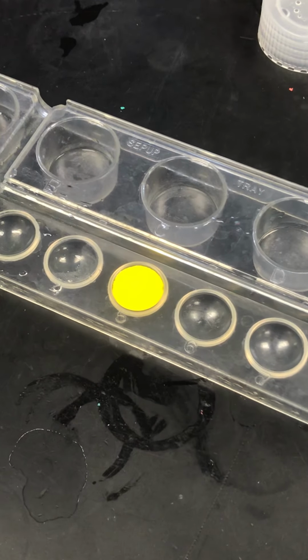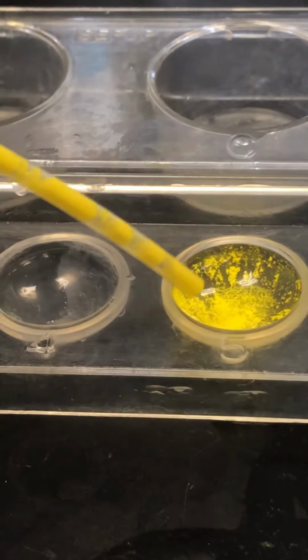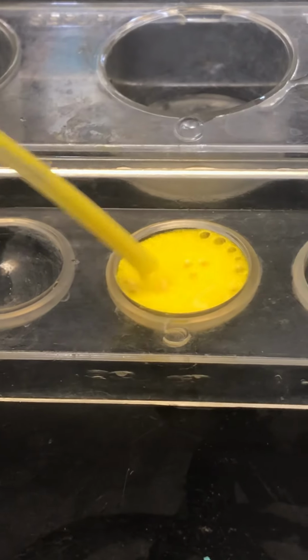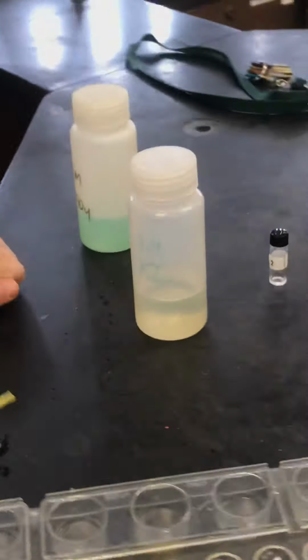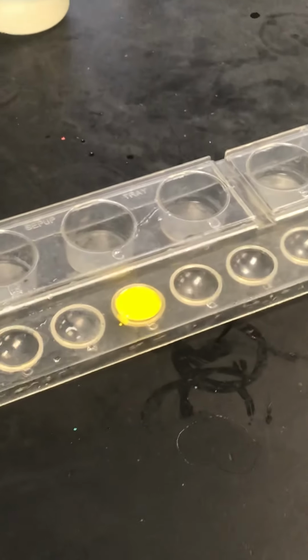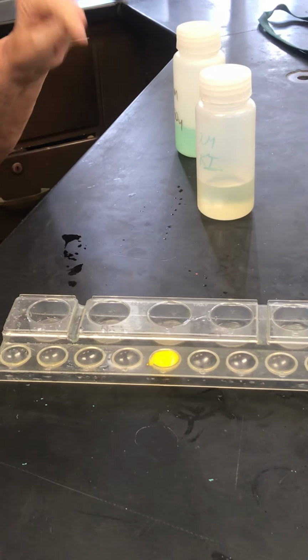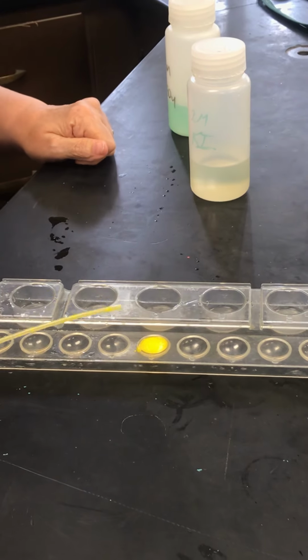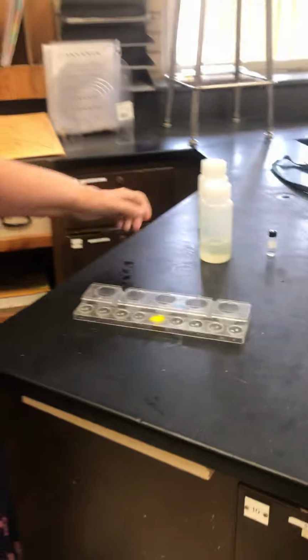I think it's yellow goo. Wonder if I could stir it. Yellow goo. Ooh, it's nice and flaky on the bottom. Kind of green and kind of colorless make yellow goo. No, it's colorless and colorless made yellow goo. That was super cool. Now let's see if we can find another one.